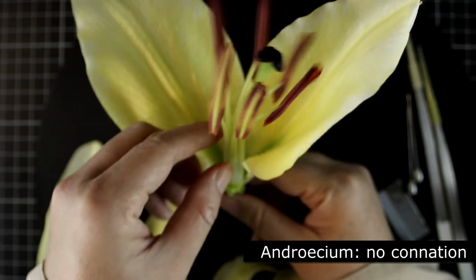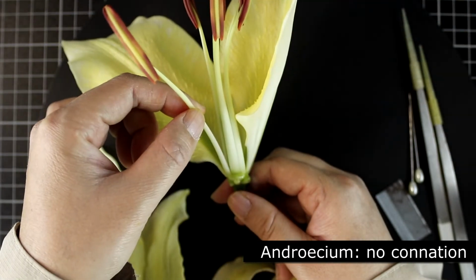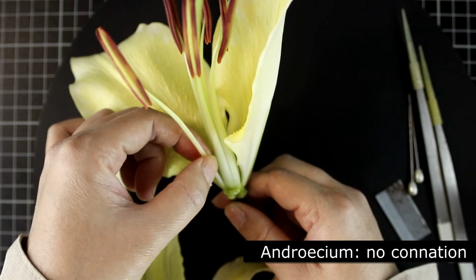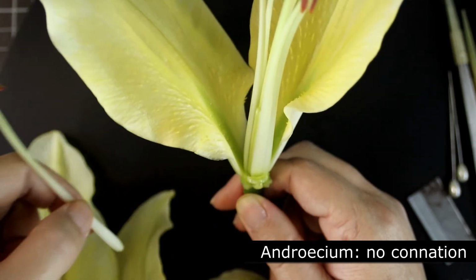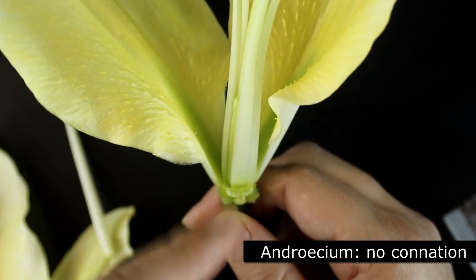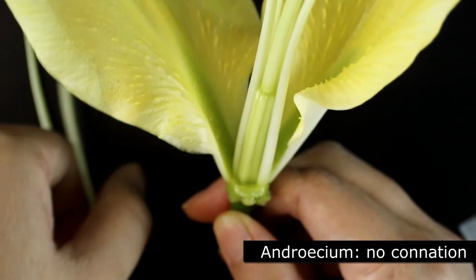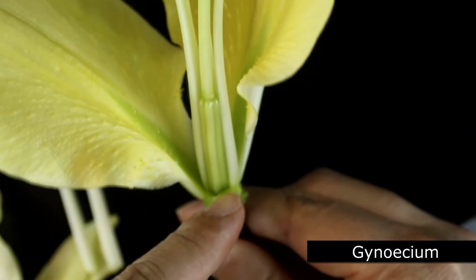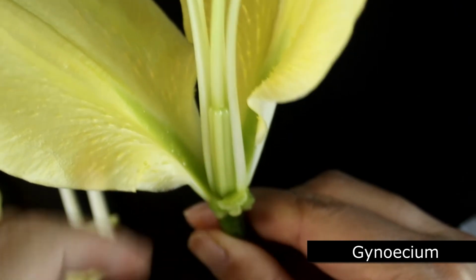For the stamens, the androecium, you can see that they're well separated, so I can remove one without hurting the other stamens in the androecium. Okay, now I can find the pistil, the female part, gynoecium.